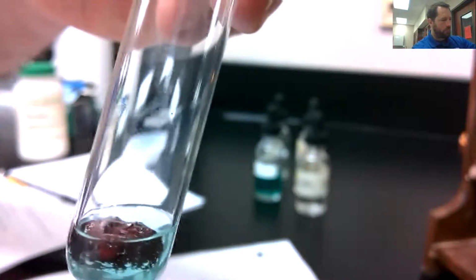Now, I know you guys might be saying, hey, there's bubbles down there. Do not write gas produced. There's not going to be a gas produced on this one. I think that is simply because there's so much heat being given off that the water is boiling. But yeah, look at that color and think about that. Wow, very hot to the touch. Very, very hot to the touch there. All right, so wow, cool reaction, huh?